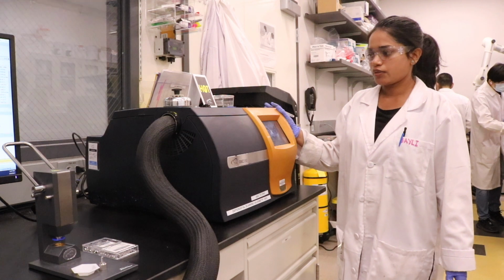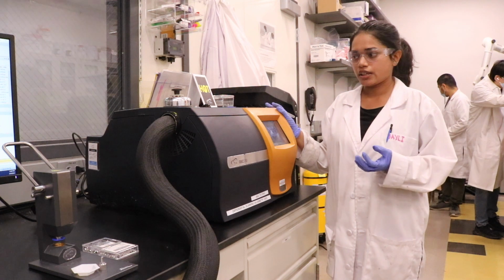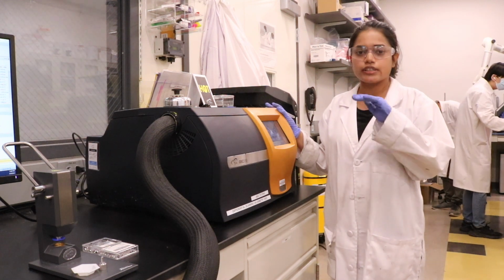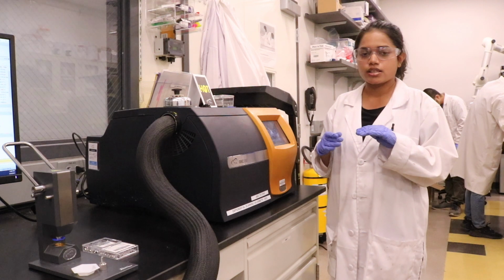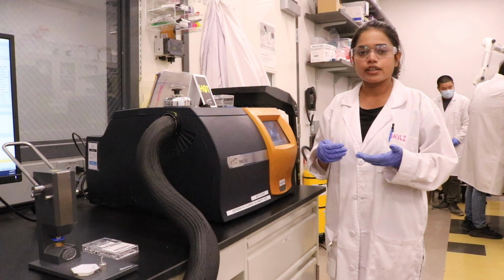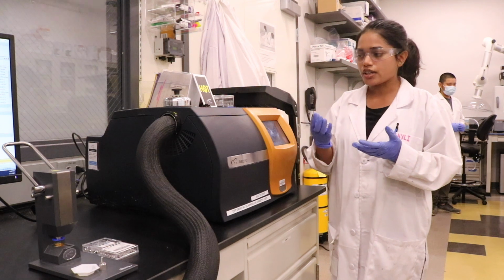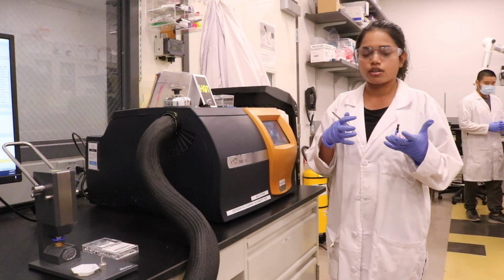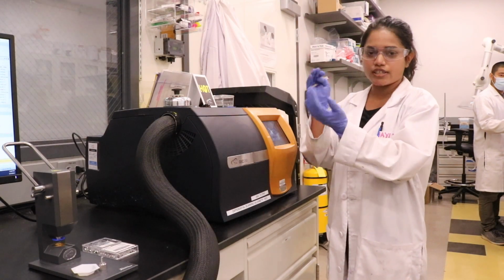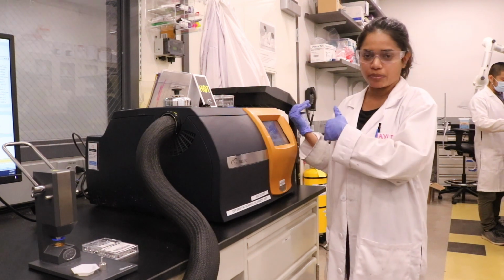So for that, we heat the polymer sample as well as the reference sample together to maintain the constant temperature throughout the test. In some cases, polymer undergoes exothermic or endothermic reactions. So depending on that, we need to increase or decrease the temperature with the addition or subtraction. So heat flow versus temperature, or the thermal transitions with respect to temperature, is determined from this instrument.